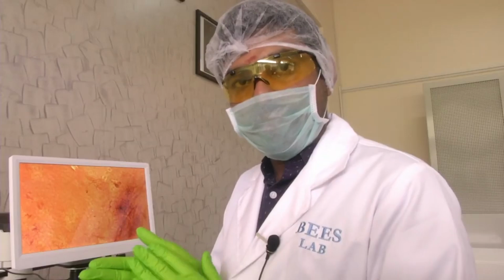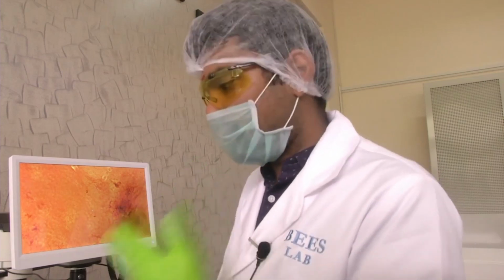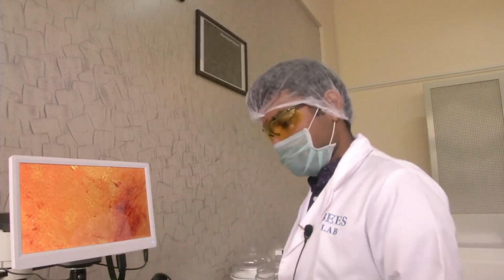If you want to study such migration assays, such real time assays, we have to have live cell imaging. For live cell imaging we need to have the option in our microscope to capture the video. That is how that video option comes into use.